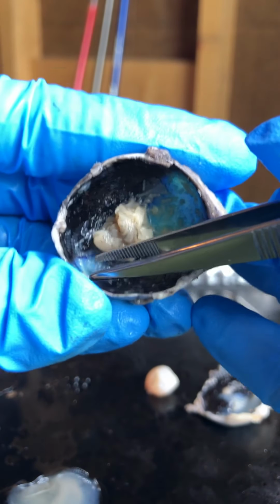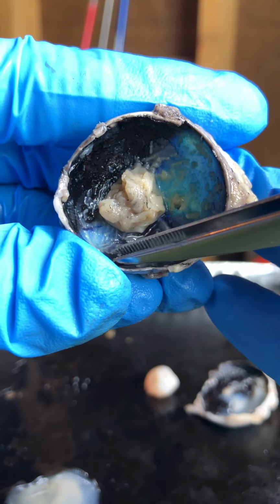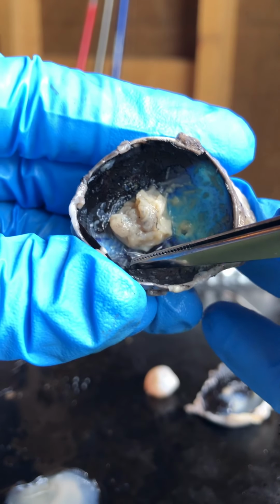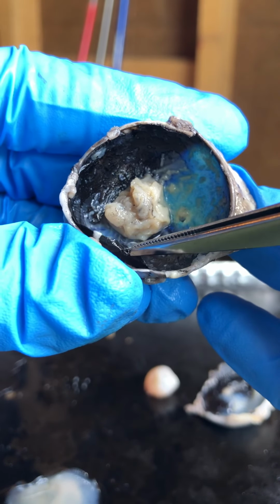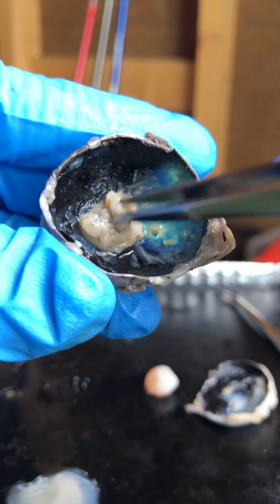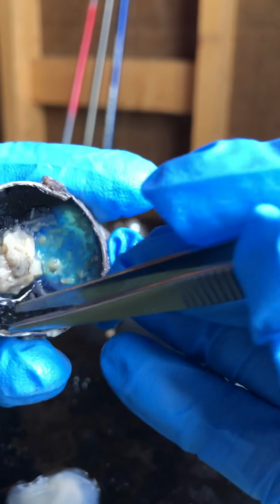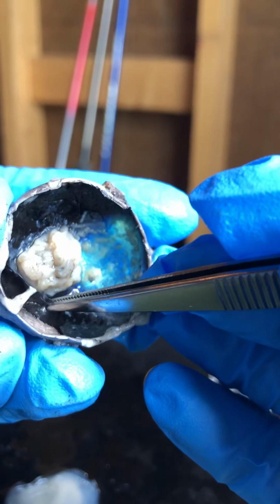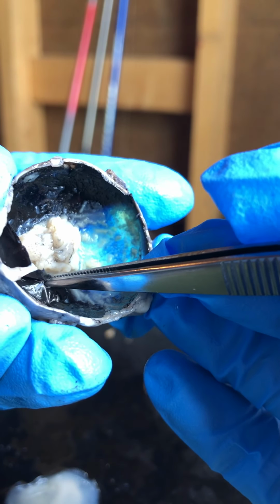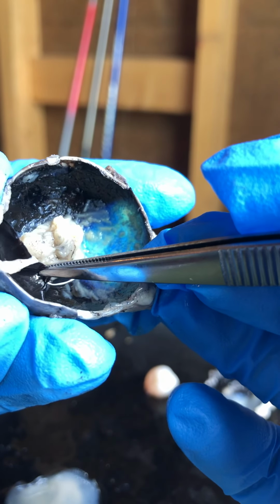this black portion is called the choroid. It is this one. The choroid is a thin, dark sheet of tissue that lies between the retina and the sclera. The choroid is very vascular and contains the blood supply which serves the eye. This black color of the choroid helps in absorbing light.